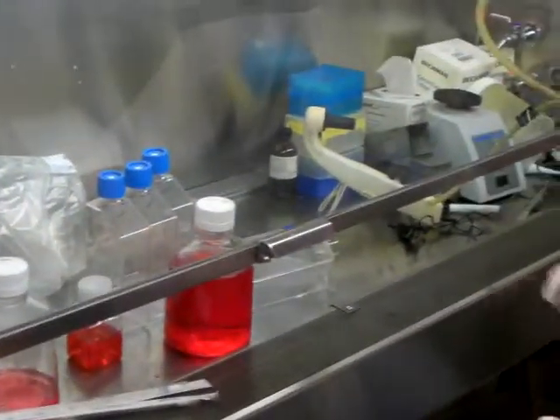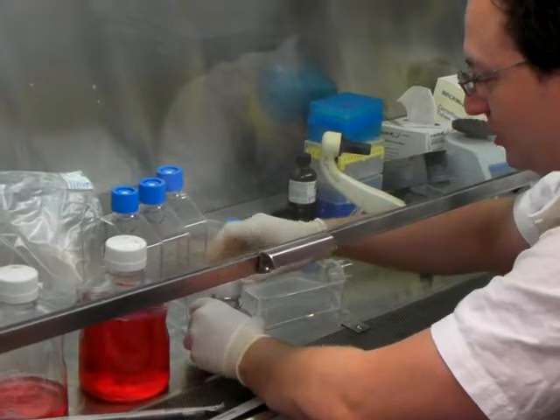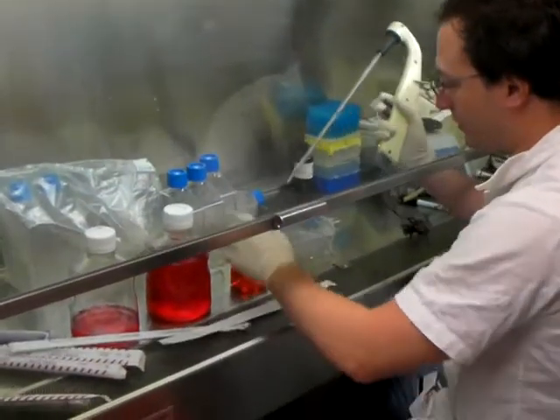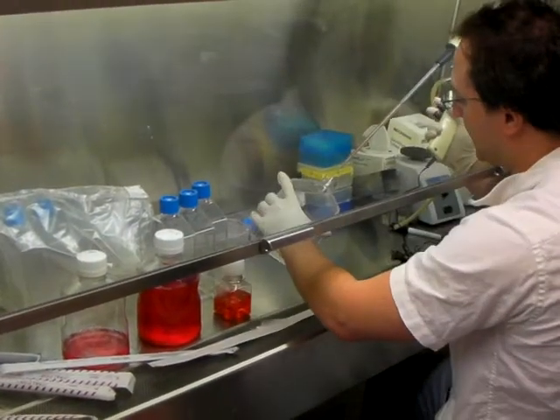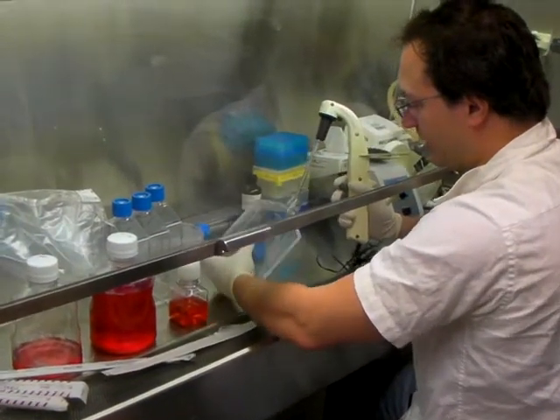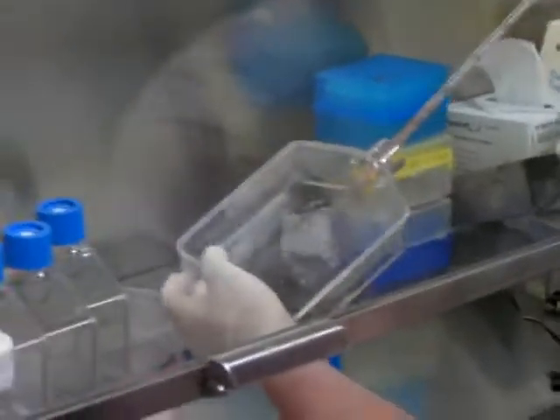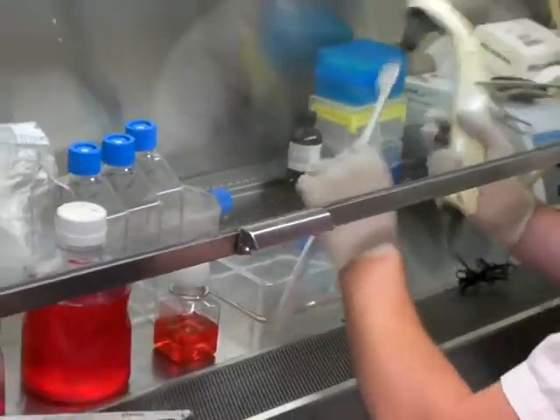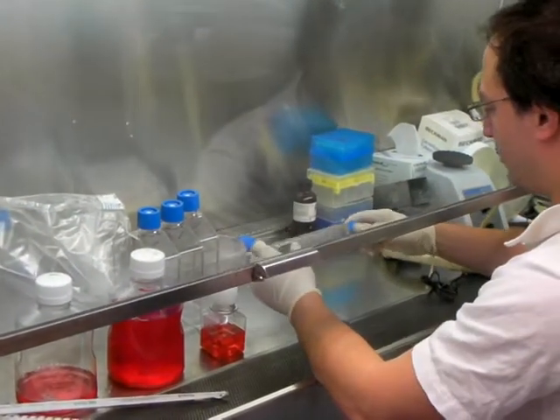Special dispenser for the glass pipettes. Now I add the trypsin — usually it's a lot warmer than this, but at room temp it's also fine. I take five mils of this; the volume will change depending on the size of the plate. I wash the top of my cells with it just to make sure that any extra protein is pulled off. This gets disposed of in the biohazard.